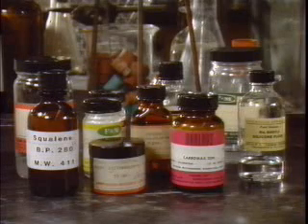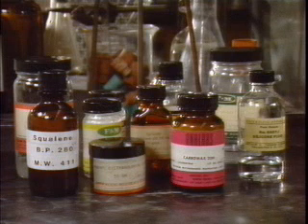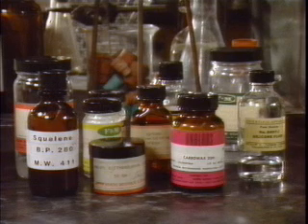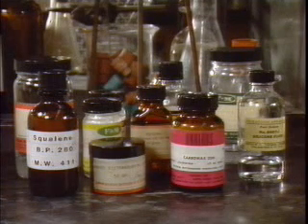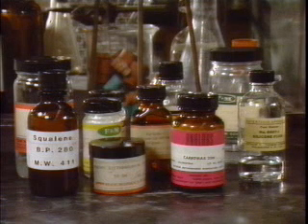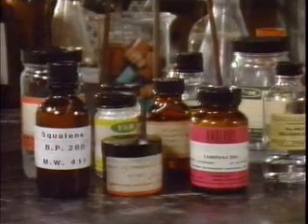In addition, in gas chromatography, as in all other kinds of chromatography, differences in the solubility of the components of the mixture in the stationary phase enhance the ability to achieve a separation of the mixture. There are many different materials that can be used for the stationary phase. The choice depends on the mixture to be separated.